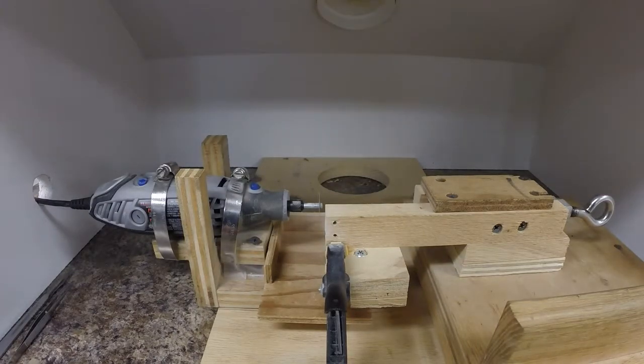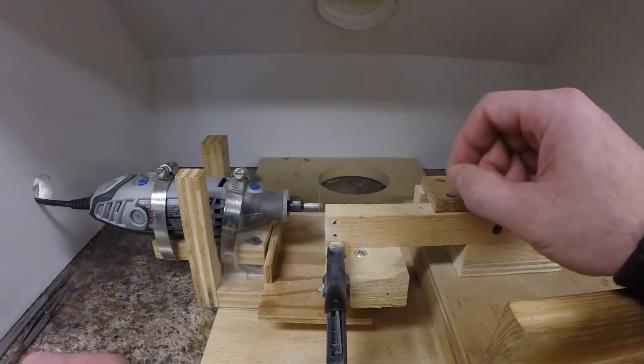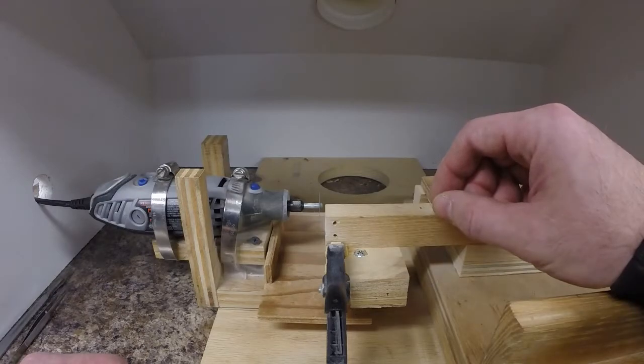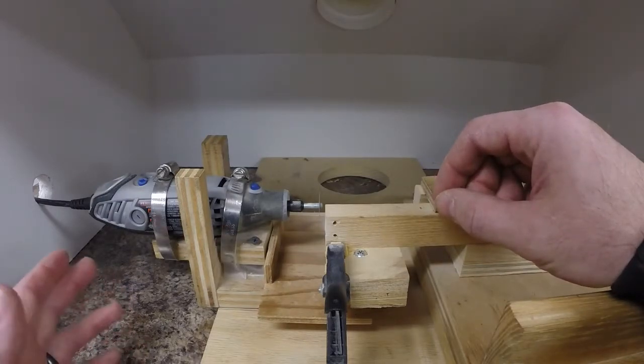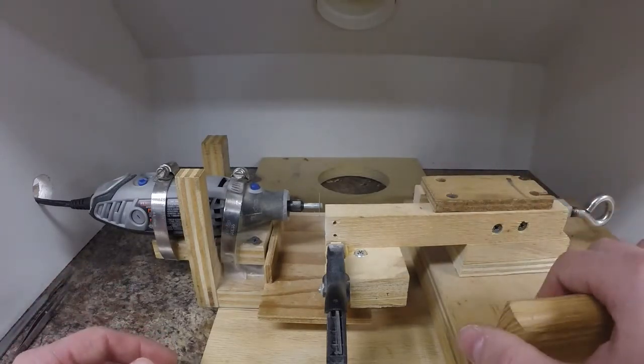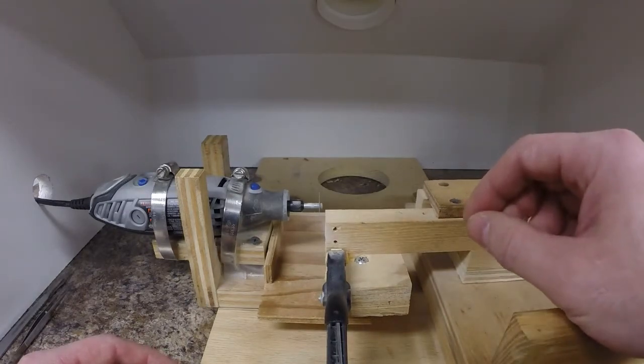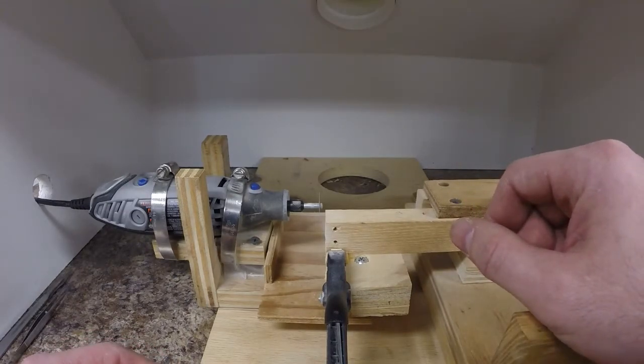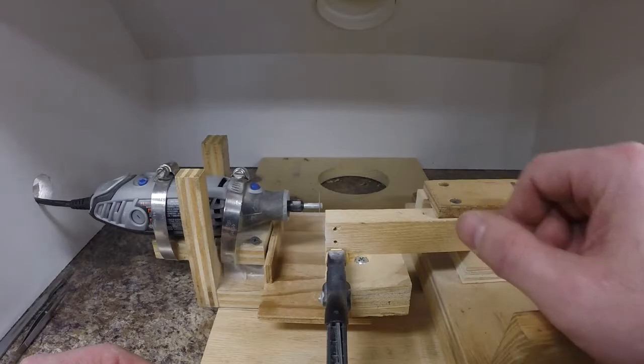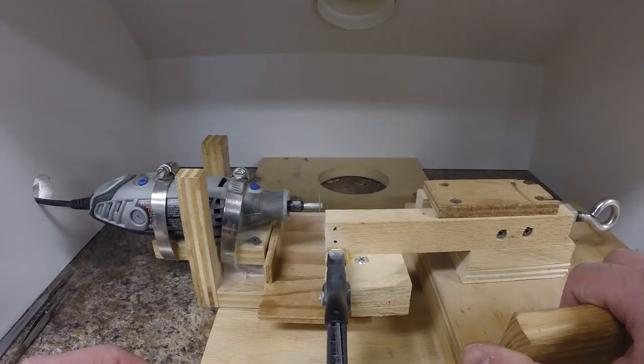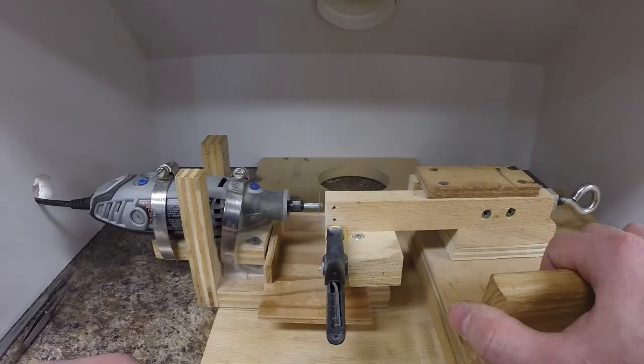There are a lot of different designs for spine cutters that people use, ranging from pretty simple to fairly complex. A simple one would be just a Dremel tool mounted on a table where you run your structure through by hand, or maybe just your Dremel tool mounted on the table with a simple carriage where you still hold it in place by hand. This is one of the more complex ones I've used. I borrowed this design from another office where I used one actually over in Newberry.